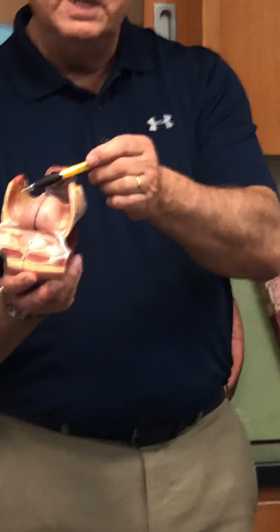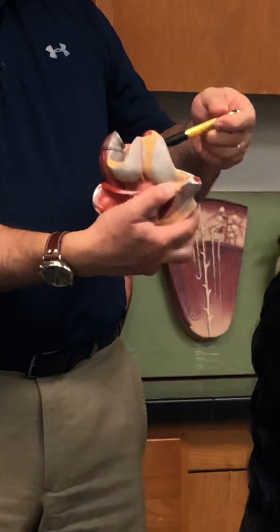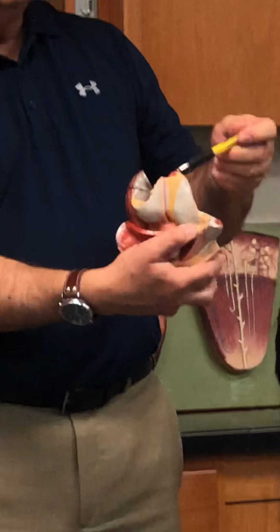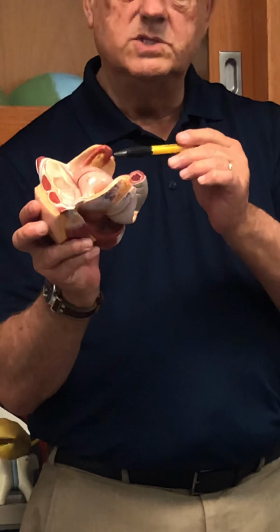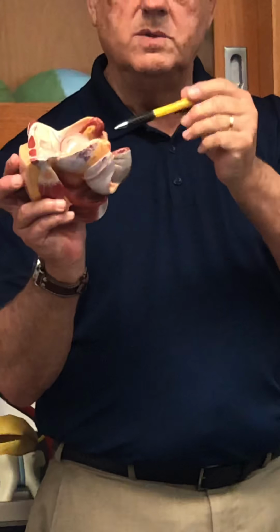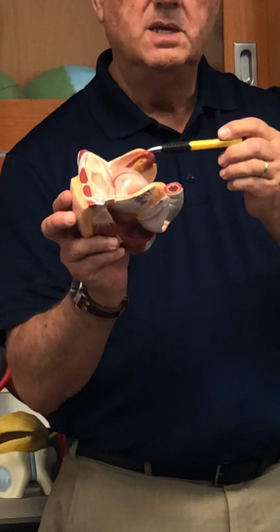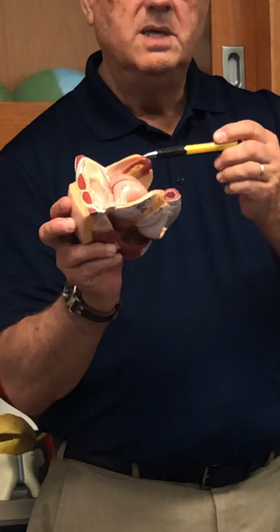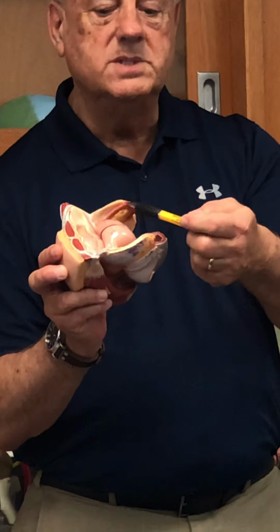All right? So you can see the ovary in here. It's that yellow portion on the inside there. That is the right ovary, and then there's the left ovary on the other side. Right? You can see they're surrounded by the uterine tube or the fallopian tube. What's this structure here, like little fingers that surround the ovary? What are these called? Fimbriae, which gives rise to this area, infundibulum, and then a little bit further down we have the ampulla of the uterine tube. And the ampulla is where fertilization takes place.